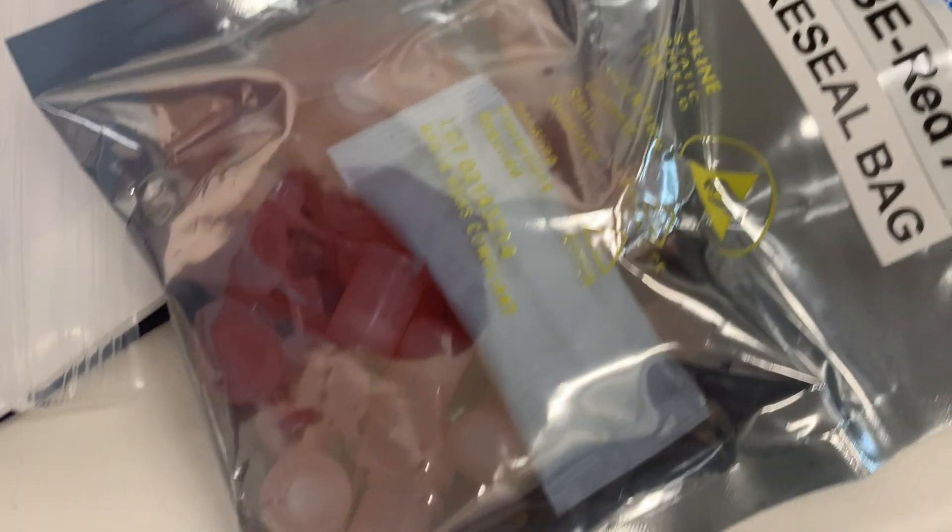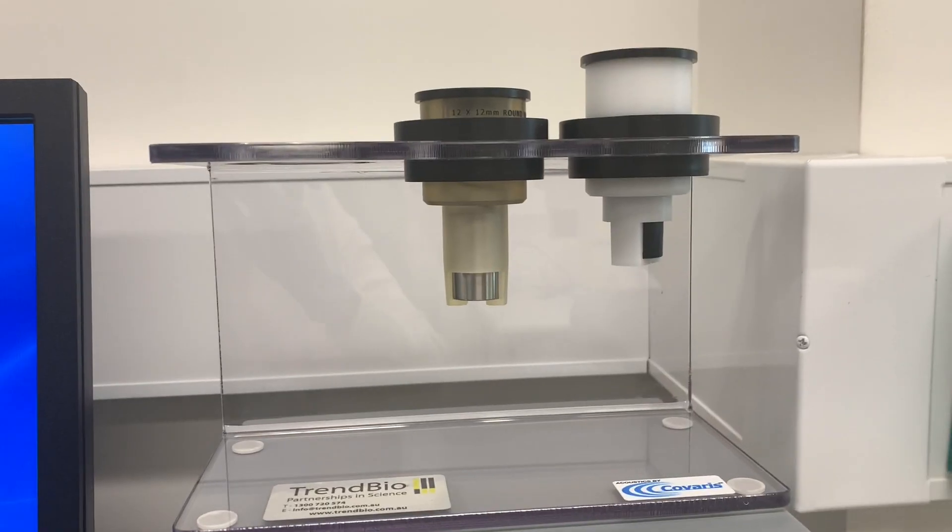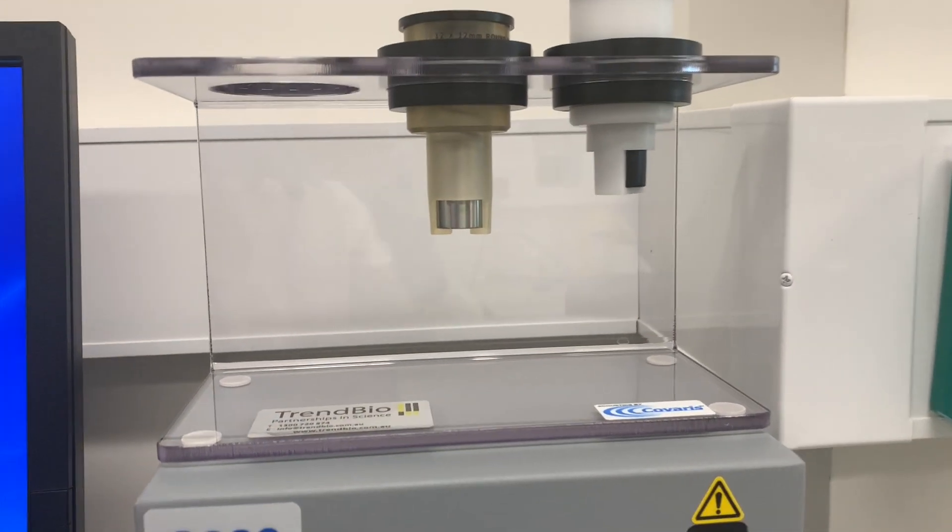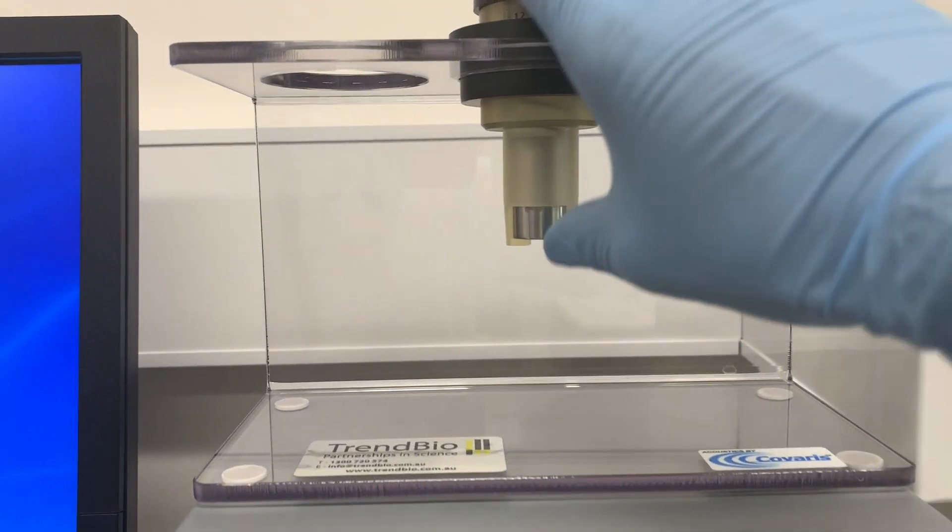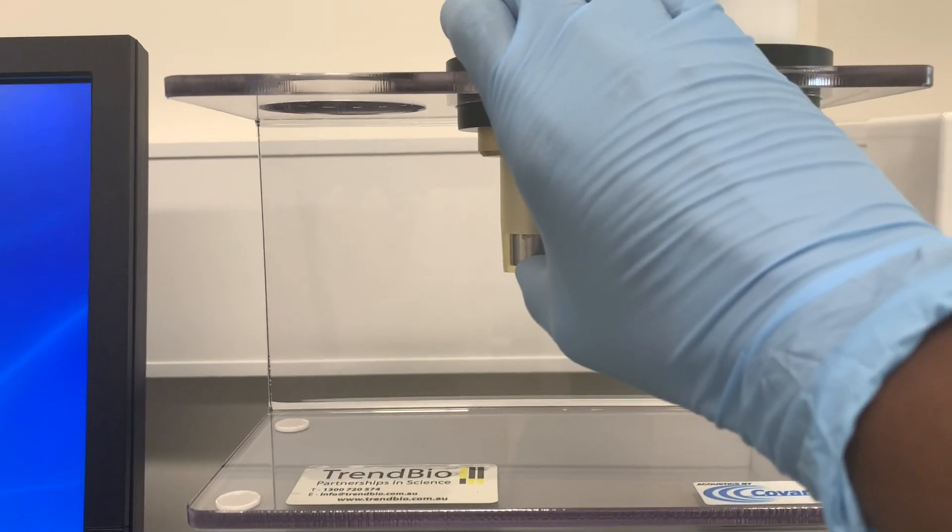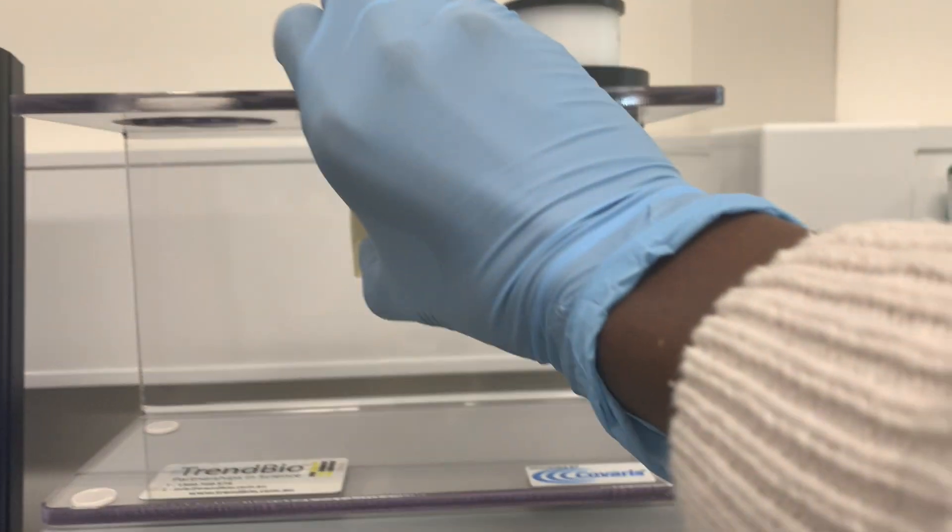Accordingly, there are different sizes for holding the vessels. You can see on the screen here, depending on the bigness or smallness of the vessel you're choosing, you select the appropriate holder.